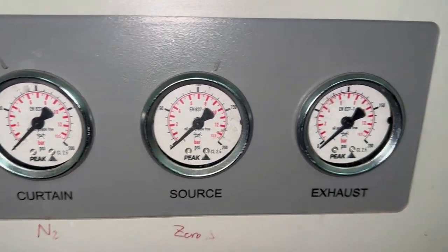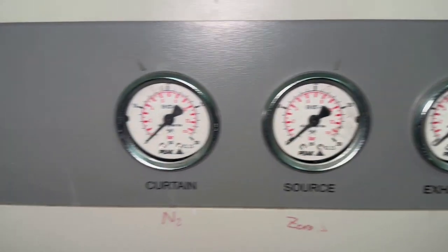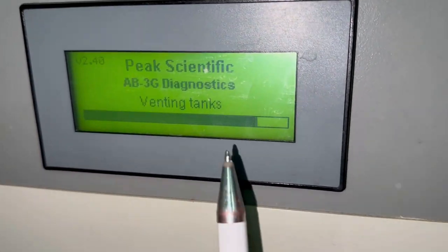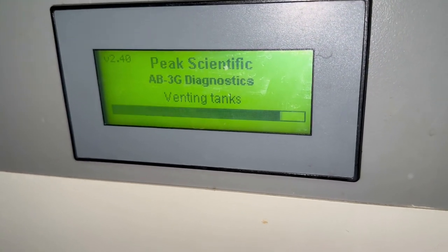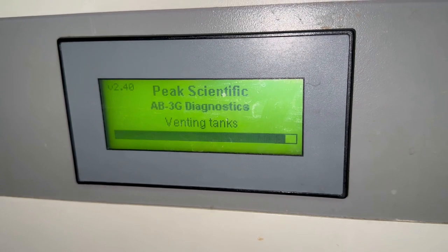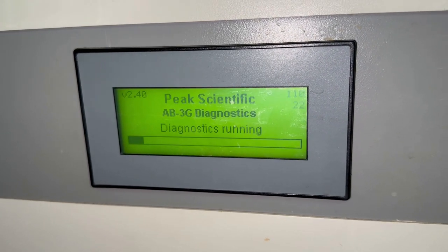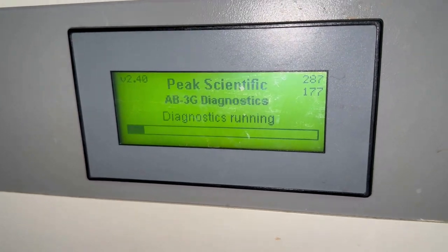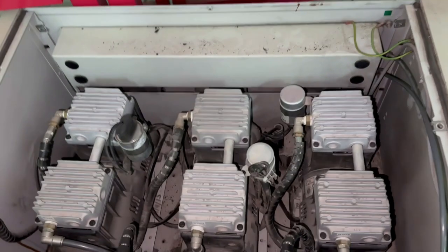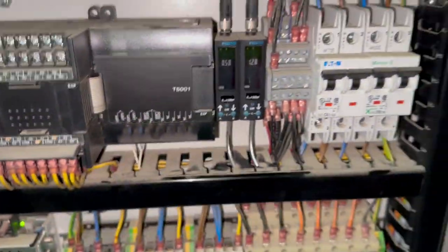At the dial gauges, you can see it's 0. Venting the tanks. Once this is completed, hopefully it will start working again in normal mode. Now diagnostic running. In the diagnostic mode, we try to check all its components, like the 3 compressors, the pressure, and the filters.